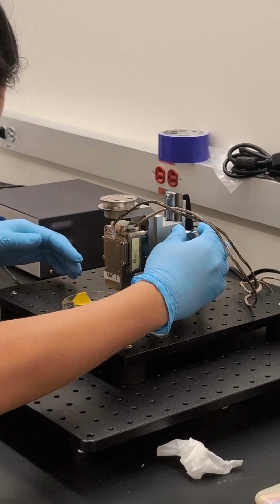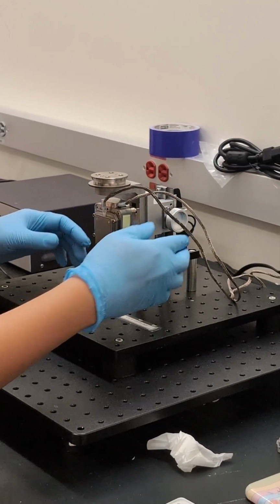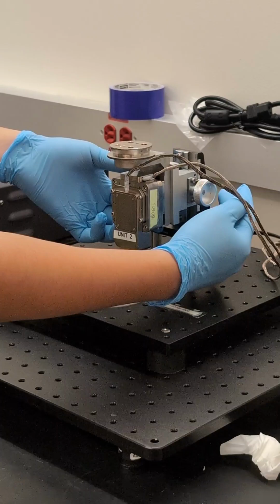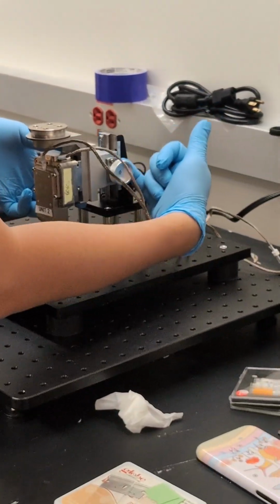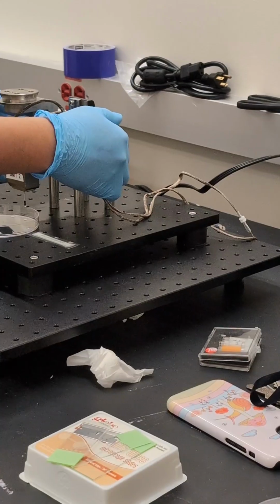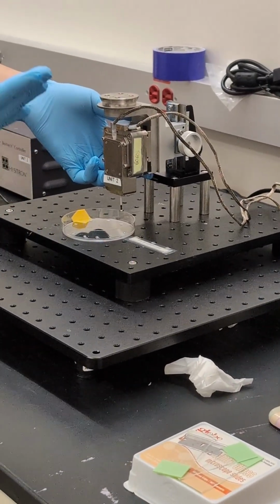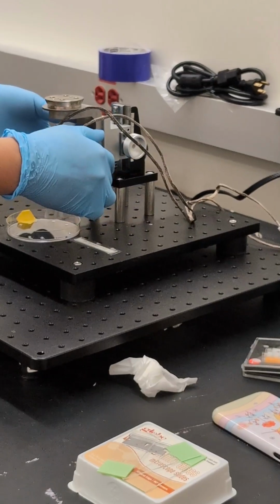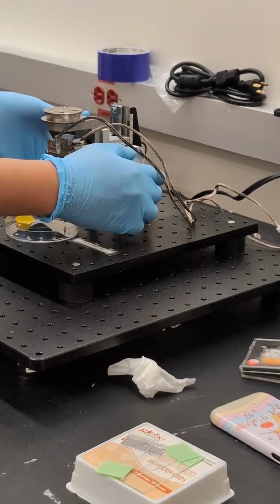Let me just move this up. Yeah, it's definitely able to indent it, even though it's kind of low. Two locking mechanisms. One is a jamming lever, which jams the actual rail behind it. I don't know if you can see it from this side. Because we have been using this quite a lot, it's gotten some wear and tear. So what happens is that I have my hand try to hold on to it, because without that, it actually just drops. So make sure you get really careful with it.